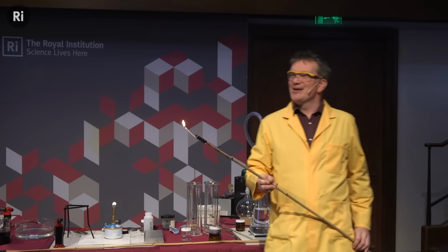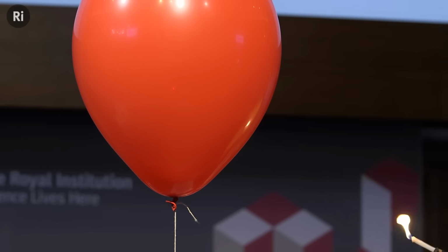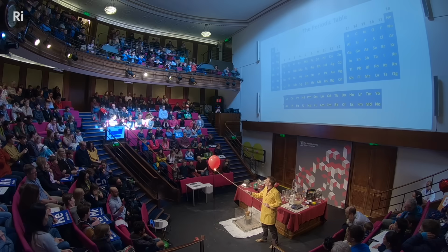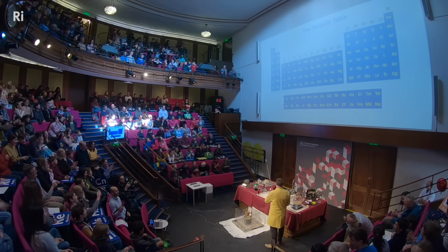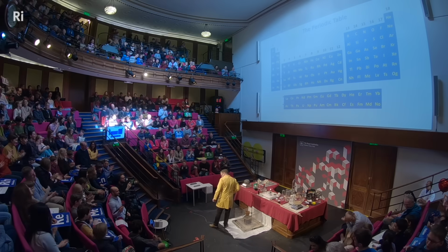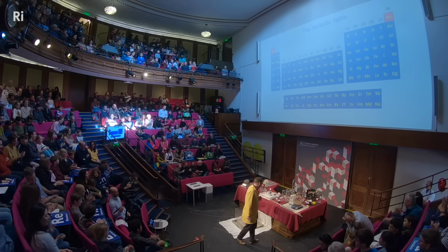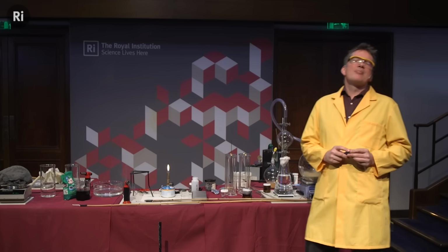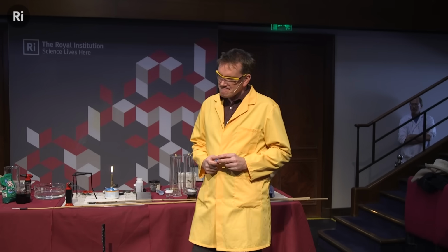So that means we hope that this one, unless Chris has played a trick on me and they're both helium, we hope that this one is hydrogen. So let's try the hydrogen one then. So let's see if this is hydrogen. Oh, that was nice. That was very nice then.